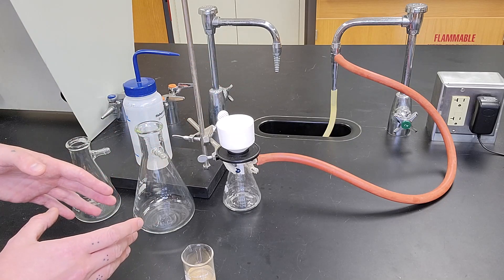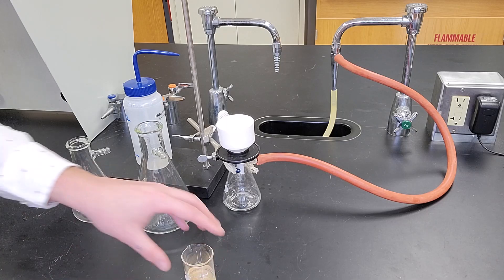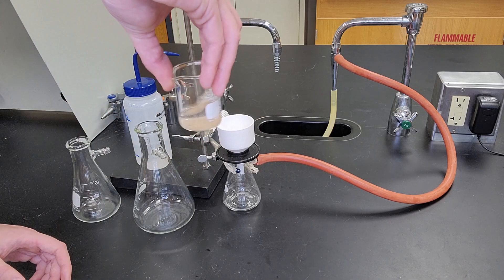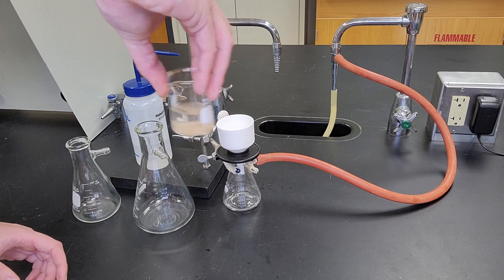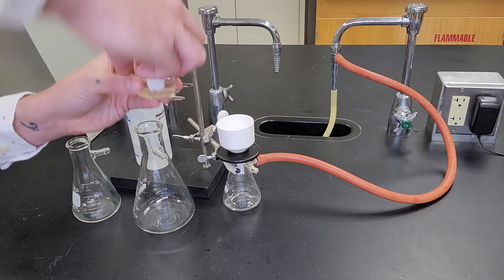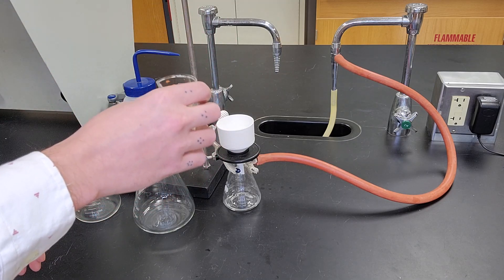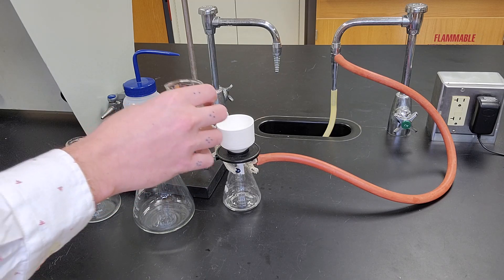I'm now ready to do my vacuum filtration. I'm going to take this, swirl it pretty vigorously to try and get the sand suspended, and I'm going to pour it fast. Again, the goal is to get as much of the sand or your solid out in one go.